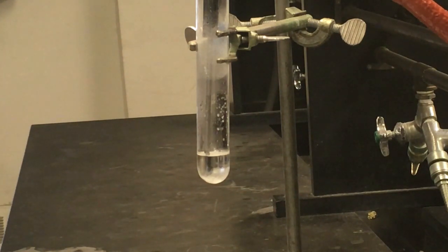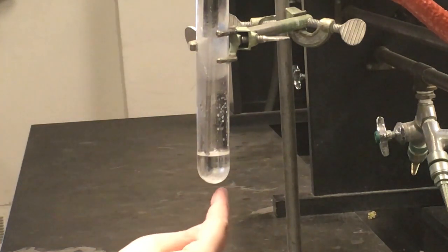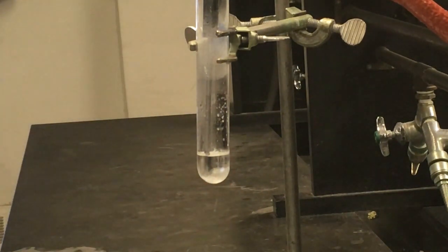All right, well, I'm going to chime in already. It does look like we're starting to get our first crystal formation, particularly on the bottom of our solution. There are crystals already starting to form. It's not the easiest thing to pick up on the camera, but you can probably start to see the fogginess near the bottom increase. That is a little bit of crystallization happening there.